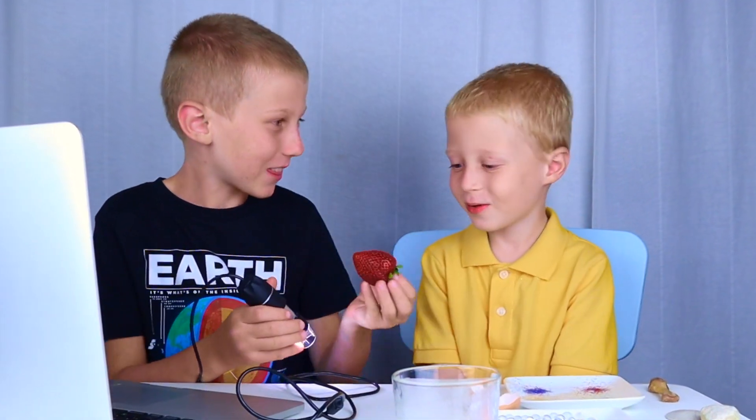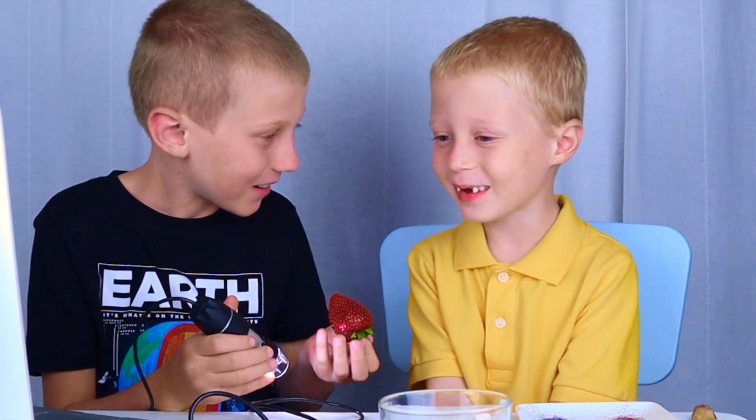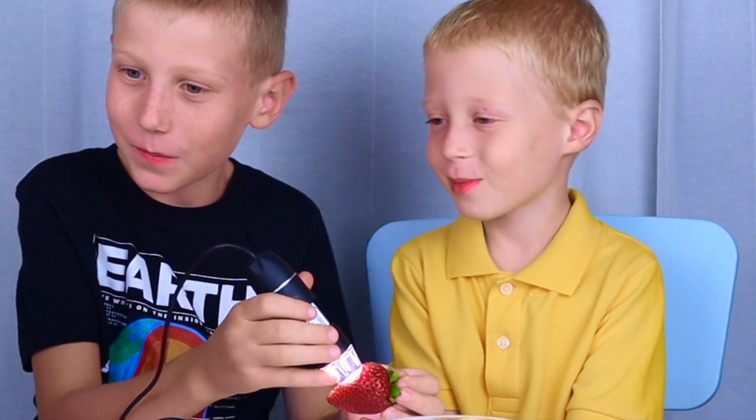Let's try this strawberry. Wow! Look at those teensy-weensy seeds. They're so big in there.